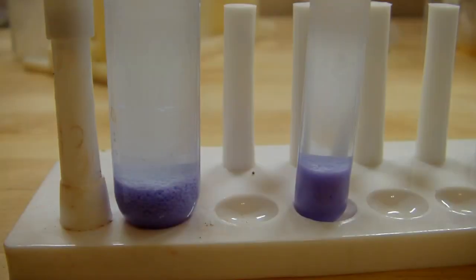Here's my product. After putting it back in the fridge for a couple of hours and letting it settle a bit, you can see nearly all of the color is gone from the solution and we're left with a pretty nice heavy purple precipitate at the bottom. I think the remaining cloudiness in the solution is just from really tiny particles of the hexaaminenickel chloride that are just suspended, and that would take a good while to settle out but I don't think I'm going to wait for that.